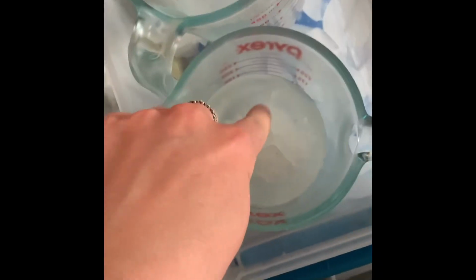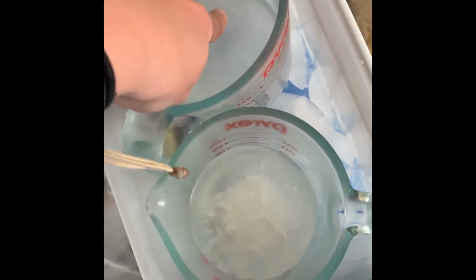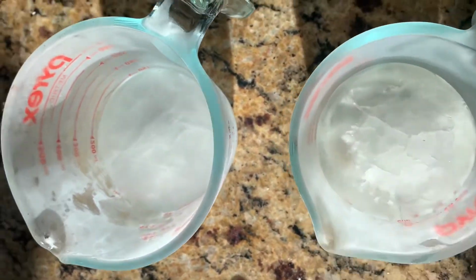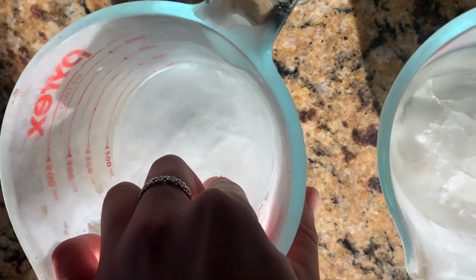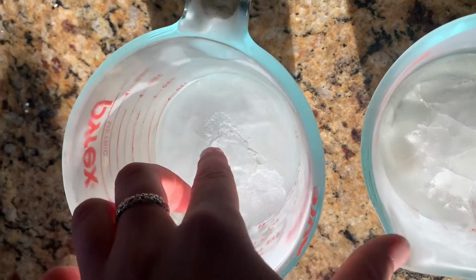I'm taking out my samples. That is the pure water. You can see it's frozen. And that is the sodium chloride solution. It's pretty frozen still. So right after taking it out, you can see it better. That's pretty well frozen. Nothing happens when I touch it. But this one, the surface breaks through really quickly, and there's a little bit of liquid underneath the surface.